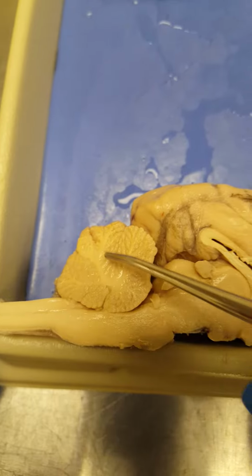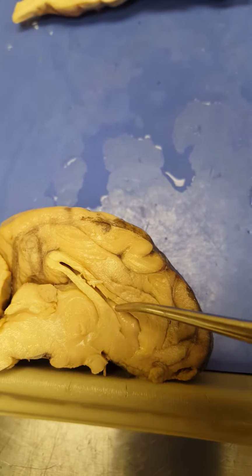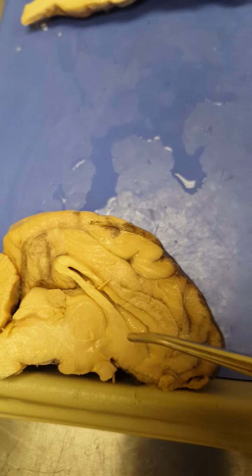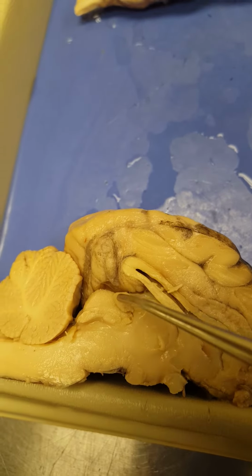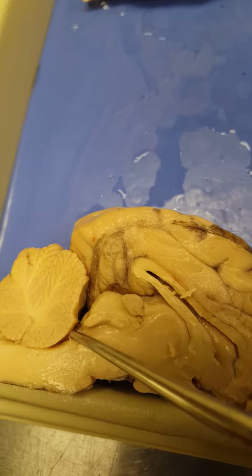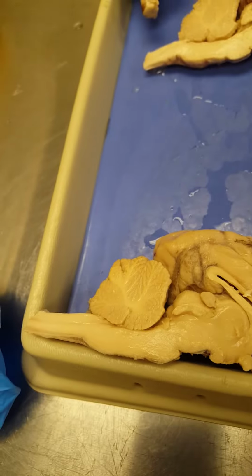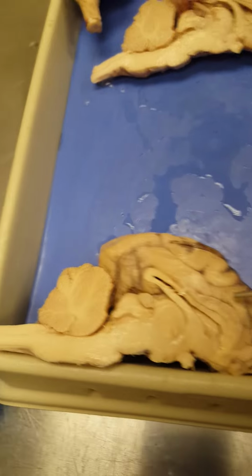Here we have the cerebellum, and you can see the arbor vitae, which is the white matter inside the cerebellum. The lateral ventricles are inside here. Okay, that's where the lateral ventricles will be found. The third ventricle would be around the diencephalon. Okay, and then it goes back down through the cerebral aqueduct to the fourth ventricle, which would be right in here. Usually when we test on the ventricles, we're going to use the actual model for the ventricles. So those are some of the structures on the sheep brain, at least on the sagittal view.